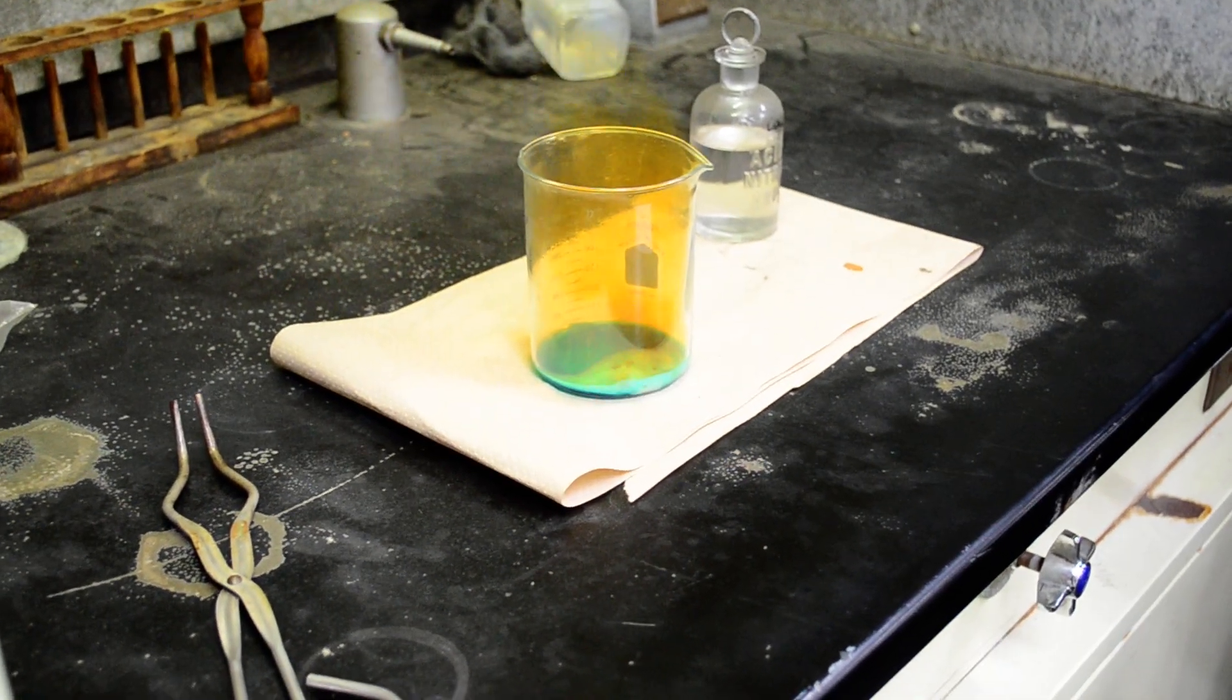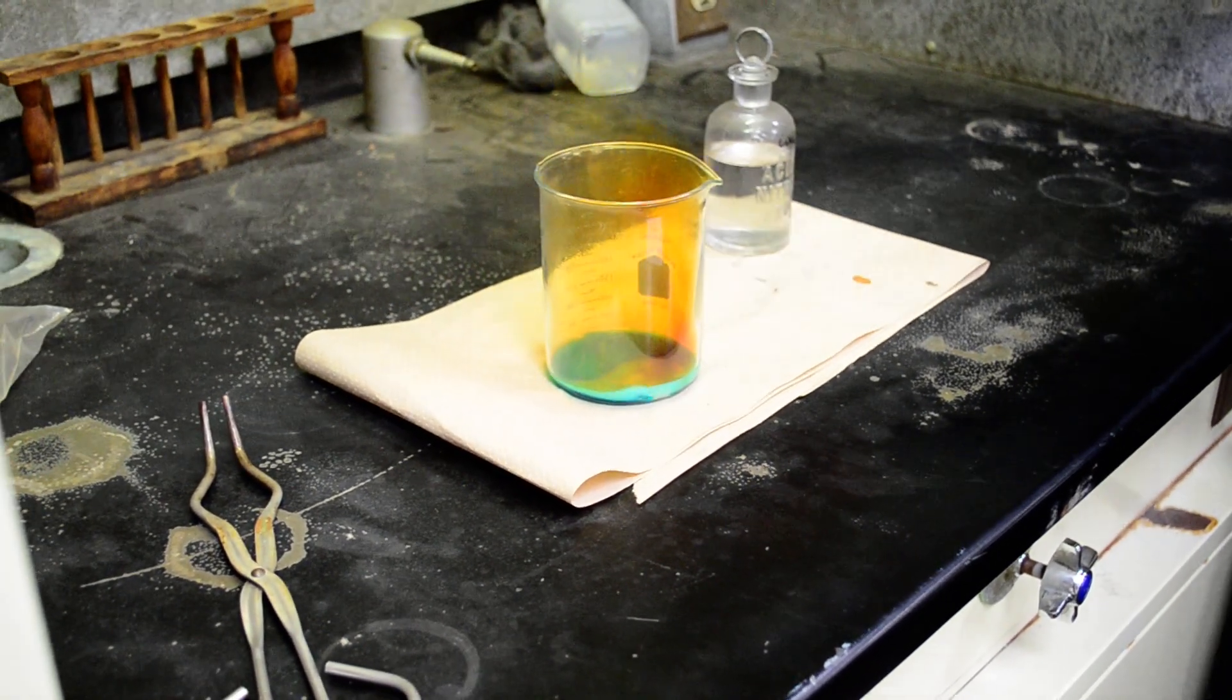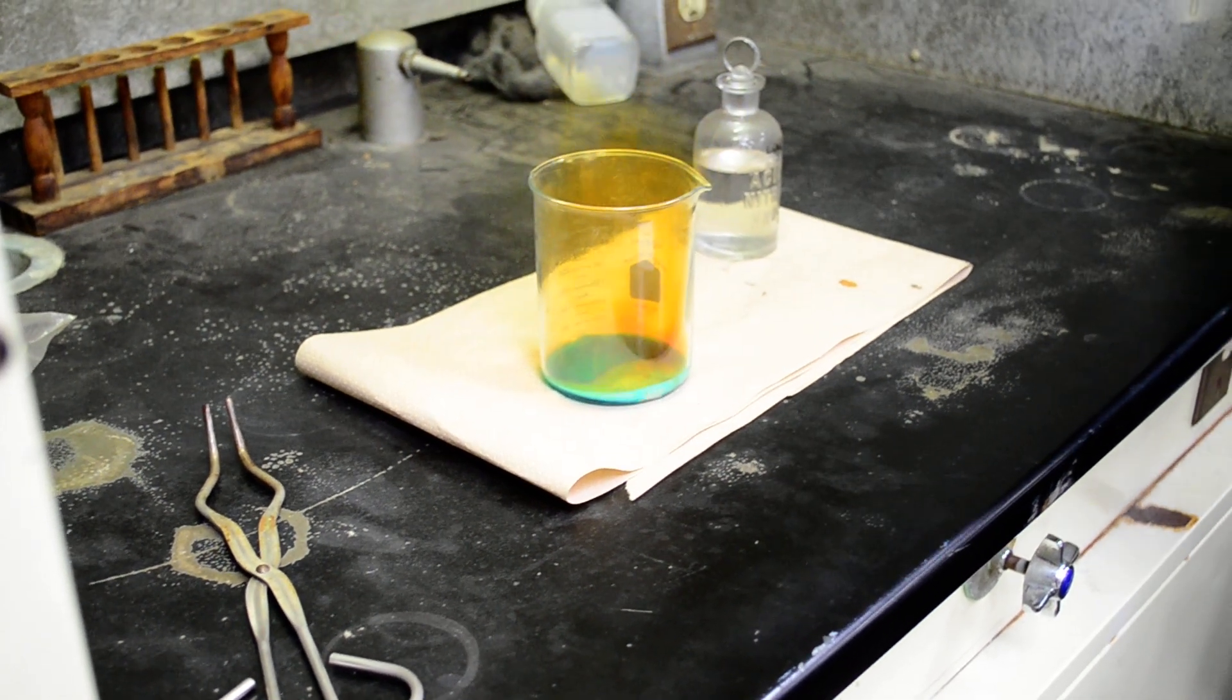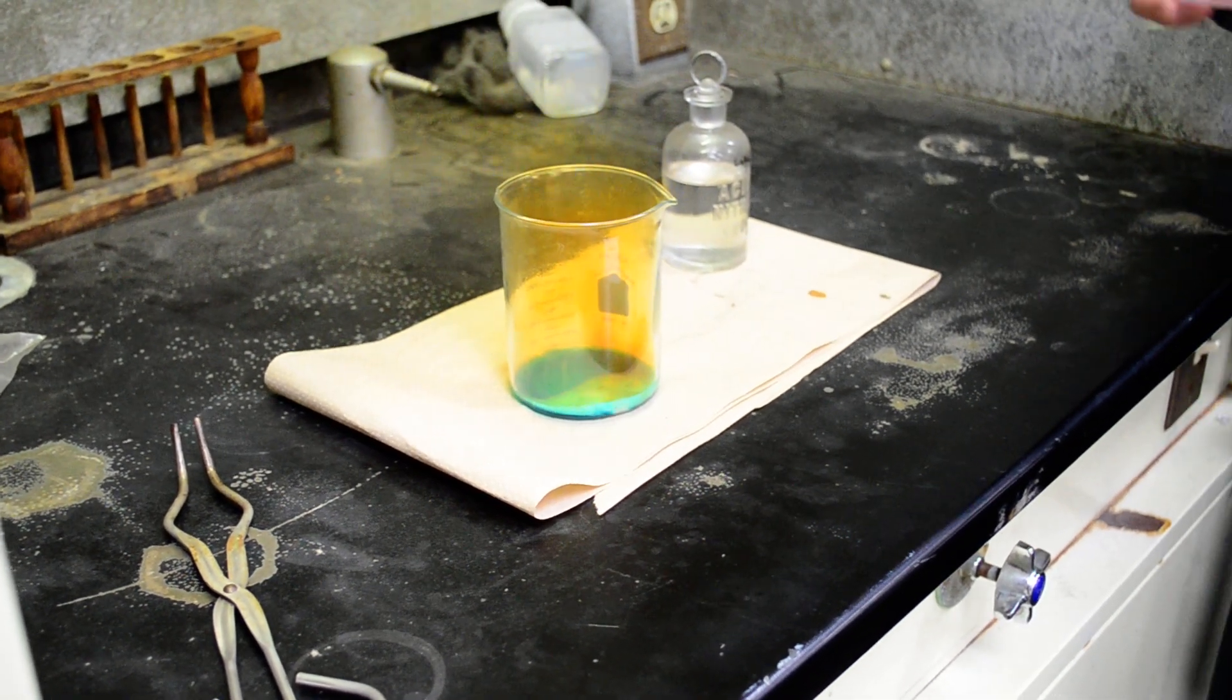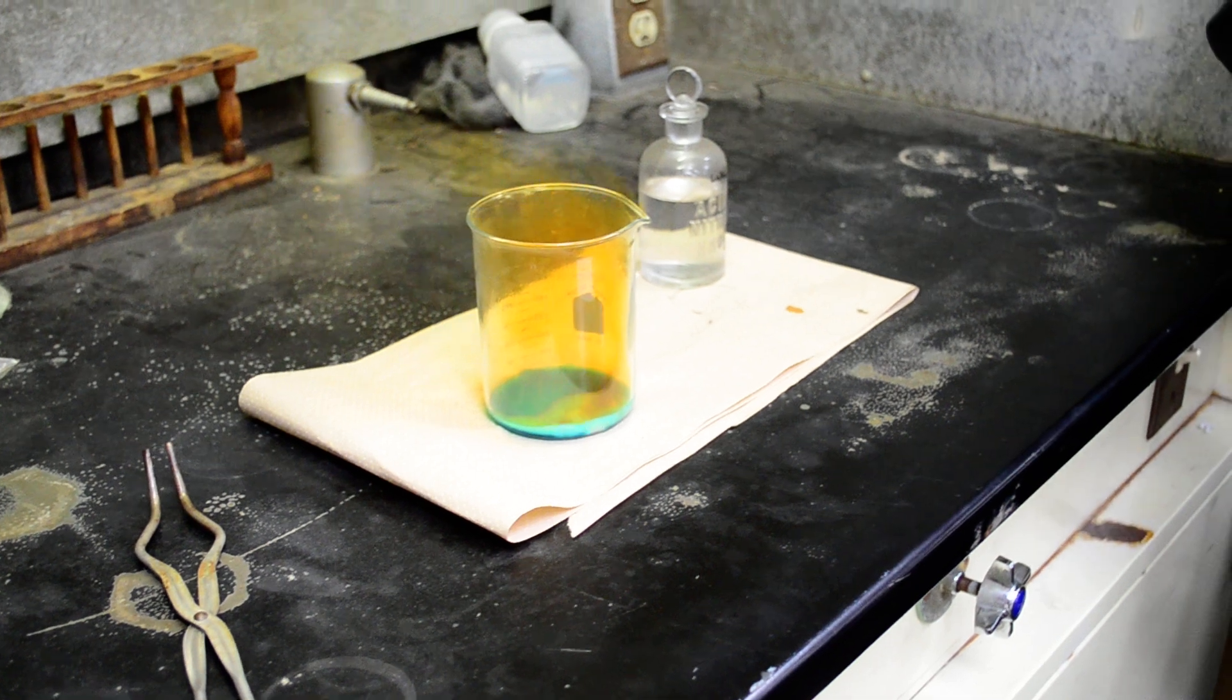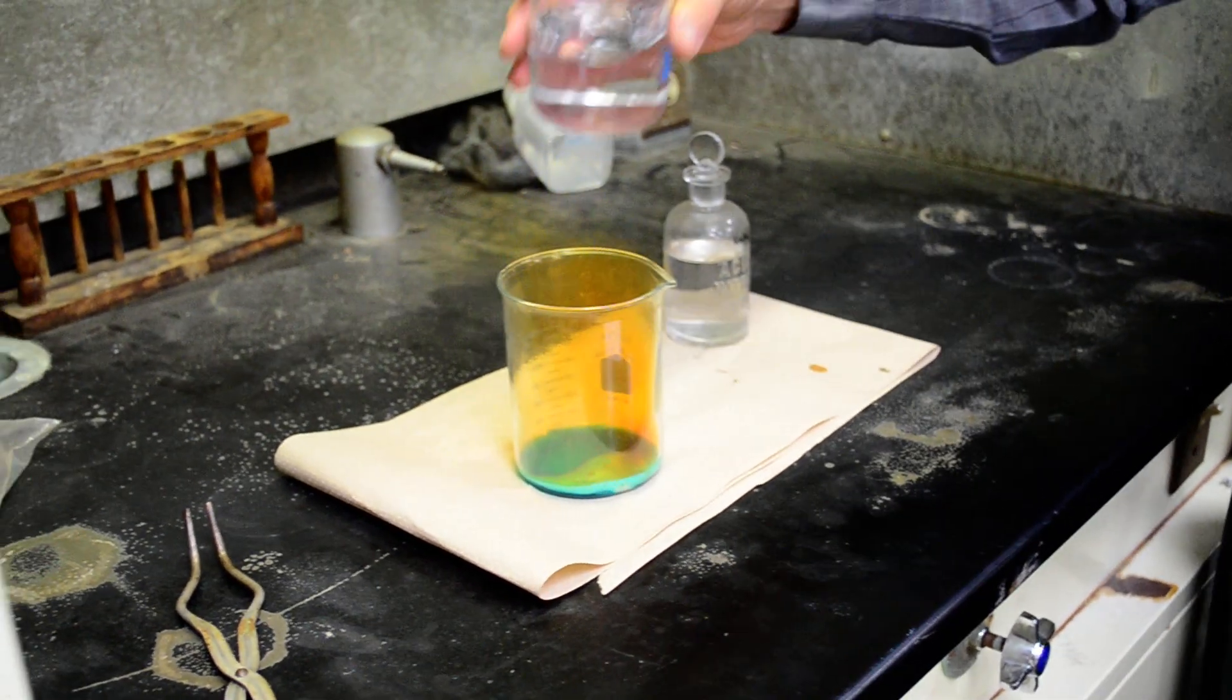We're putting more into the air right now. Absolutely. Yeah, you see, you will be poisoned as you go to lunch today. It's all going to settle in the quad. No, just kidding.